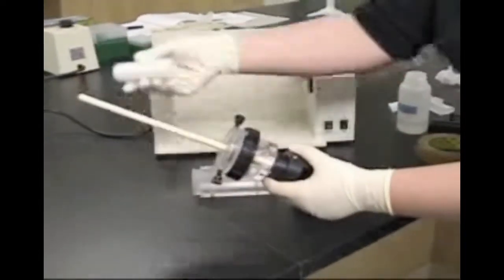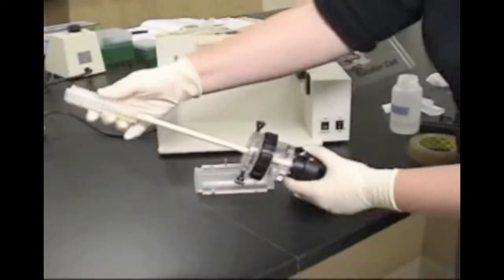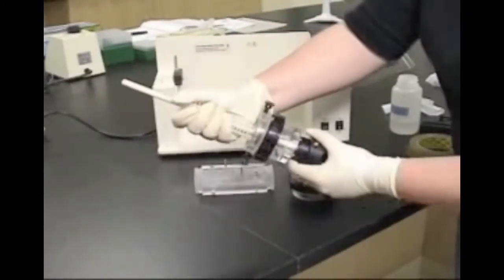Next, slide the membrane core onto the cooling finger, pulling it down until it reaches the anode chamber.